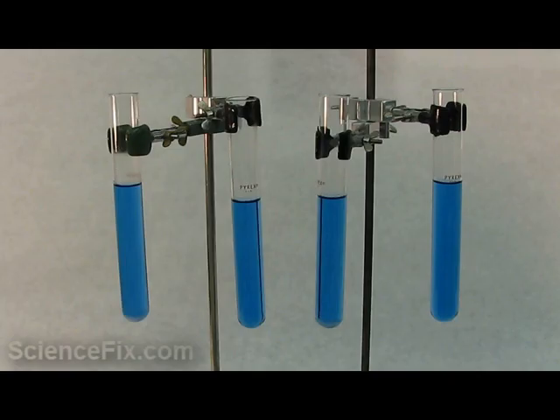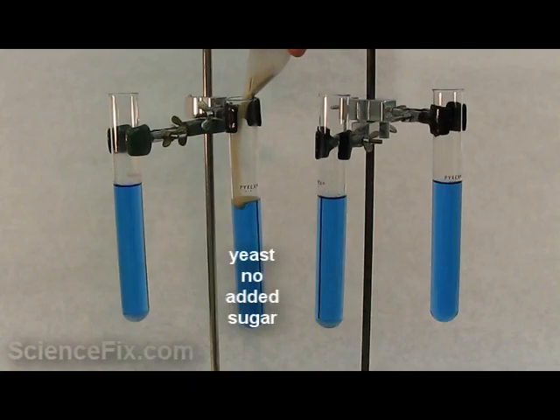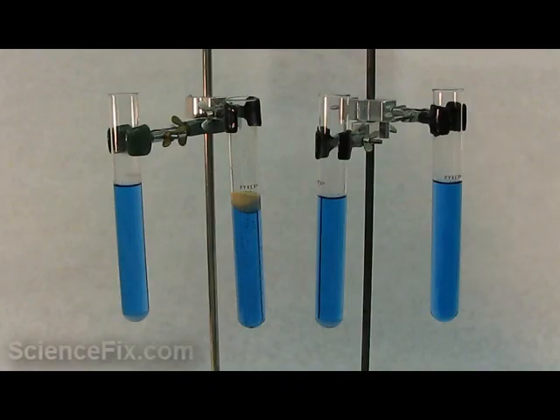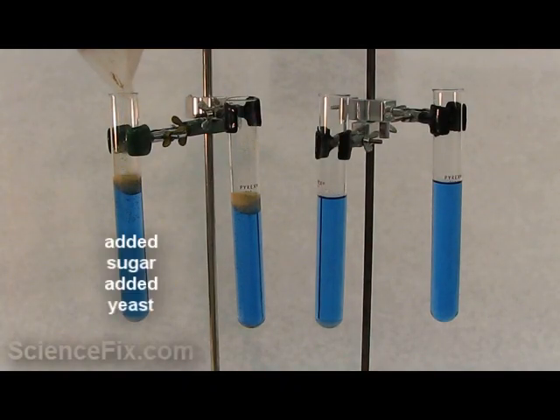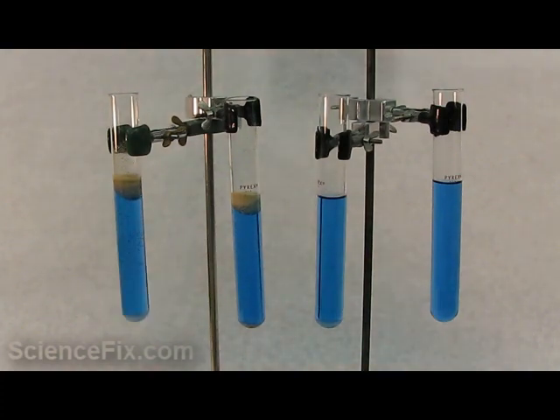That's a really good temperature for yeast cells to thrive and do cellular respiration. In the far right test tube, we have bromothymol blue solution only - that's our control group. In the test tube second to the right, we have sugar only. In the third test tube, we have yeast only. And the one all the way at the left has yeast and sugar.